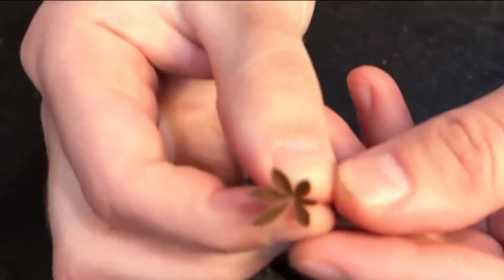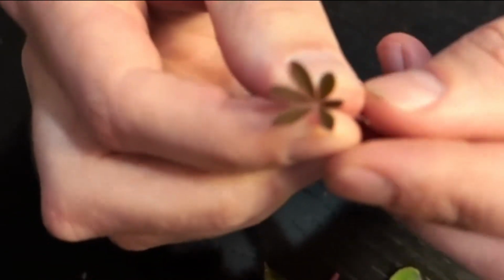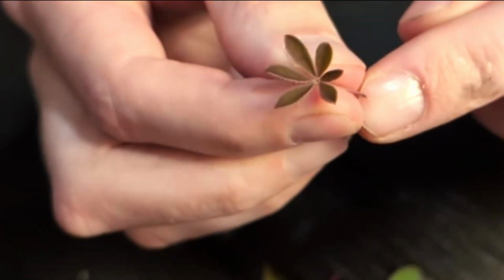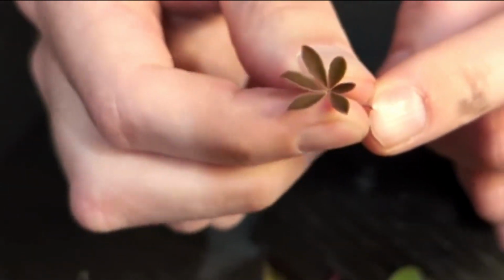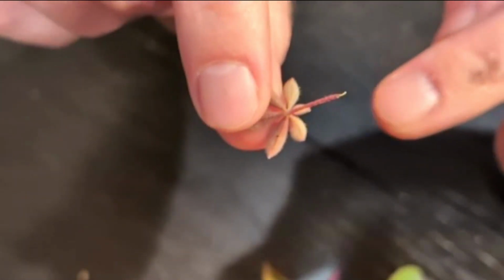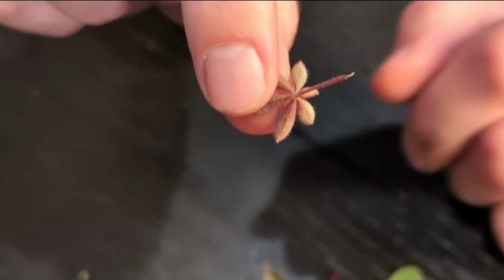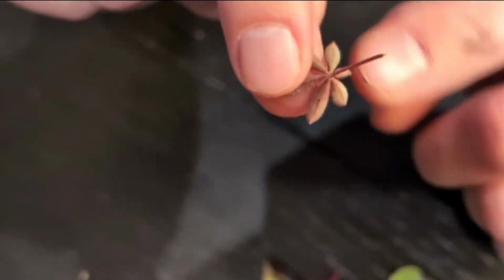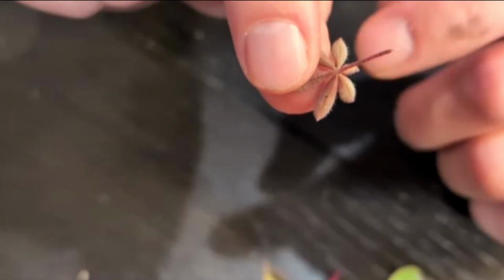So here is a little lupin leaf. See if we can get that focused. The little stem I'm holding is the petiole, so I broke that off the actual plant. I only grabbed the little leaf because I didn't want to hurt these little ones. And if you notice, the petiole attaches in what looks like the center of a lot of little leaves. This is actually one leaf. The petiole plus all these little leaf-like things is a single leaf.